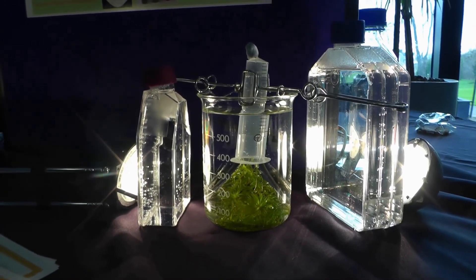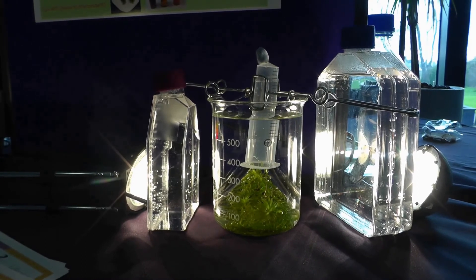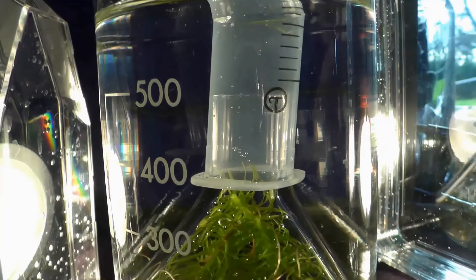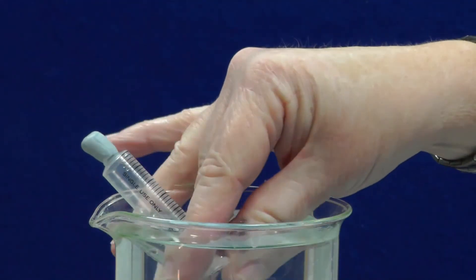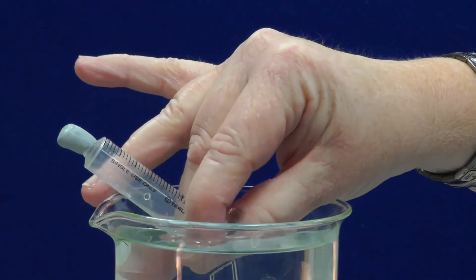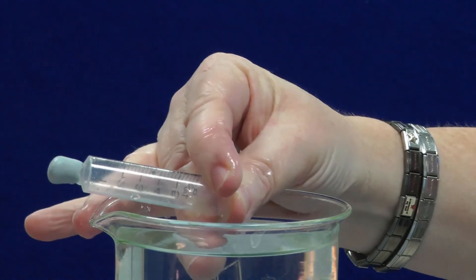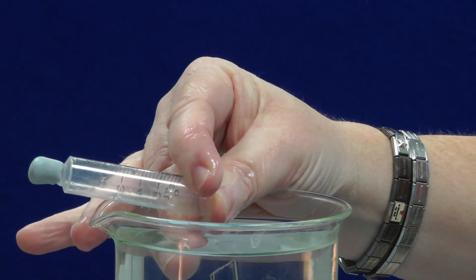This setup can be used to investigate the volume of gas produced in a given time. The gas collected in the syringe will relight a glowing taper proving that it is oxygen.